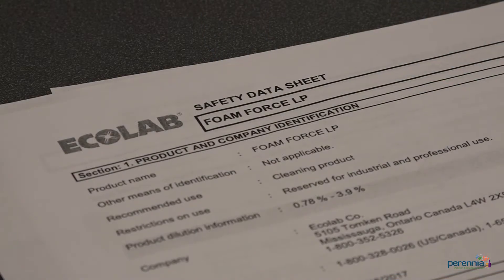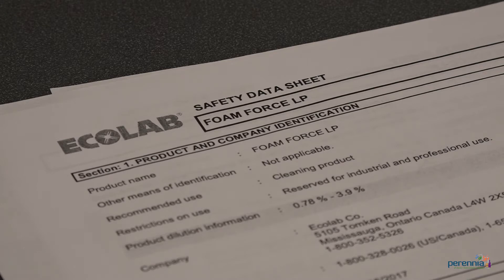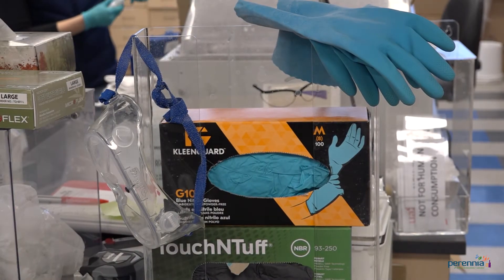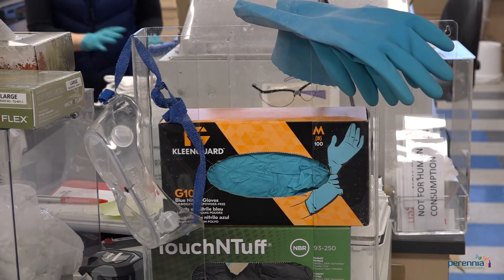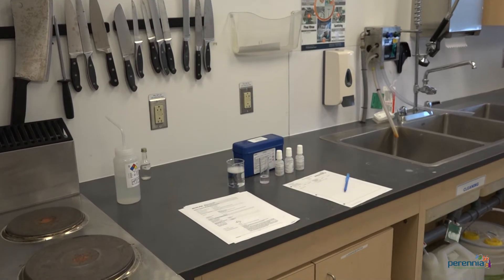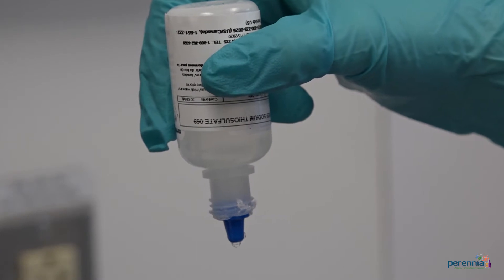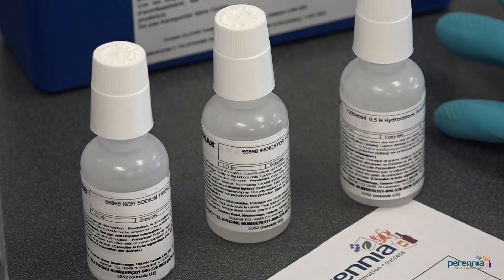Before you get started, ensure the safety data sheets are available for all chemicals including those in your test kits, and that you read them. Put on the required personal protective equipment, for example gloves, eye protection, etc. Perform the chemical concentration verifications in a well lit area. Hold all the test kit dropper bottles vertically to ensure the correct number of drops is being dispensed, and ensure the test kit chemicals are not expired.